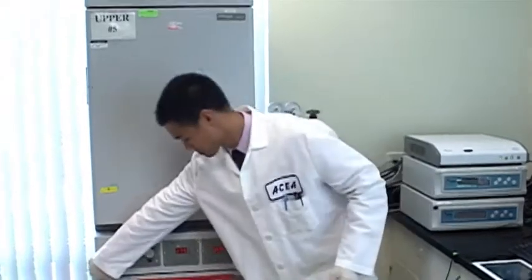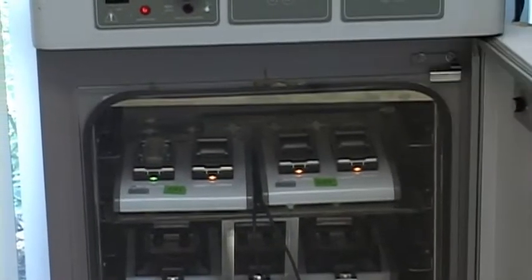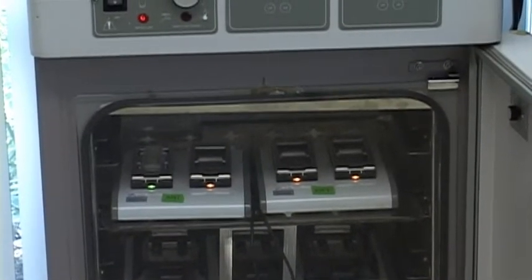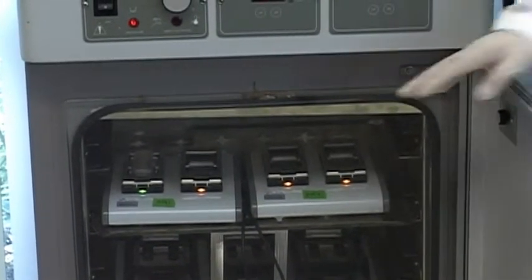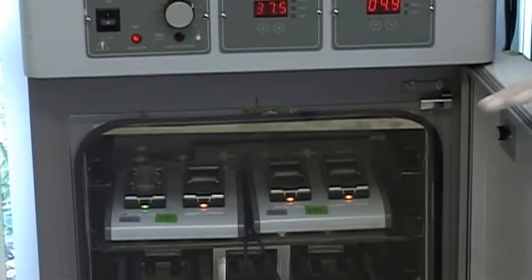So the first step, and this applies to all our assays run on the iCelligence, is to set up the iPad connection to your iCelligence station. So here, we have the iCelligence station already pre-incubated at incubator conditions, 37 degrees C and 5% CO2. And as you can see, as indicated by the orange light on this unit, it's currently in standby mode.